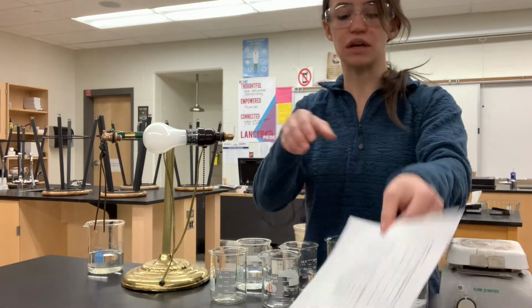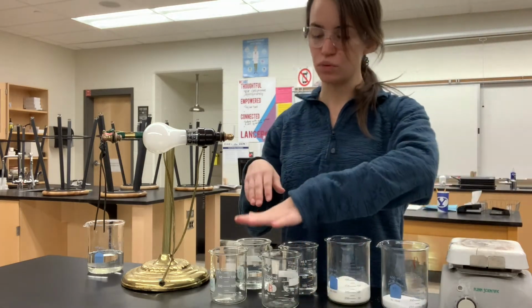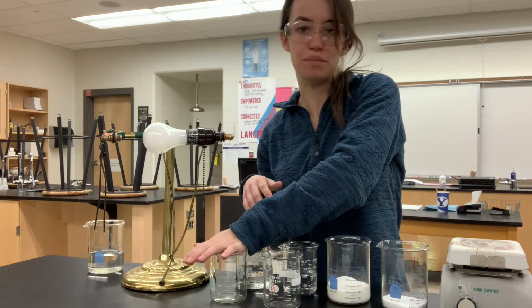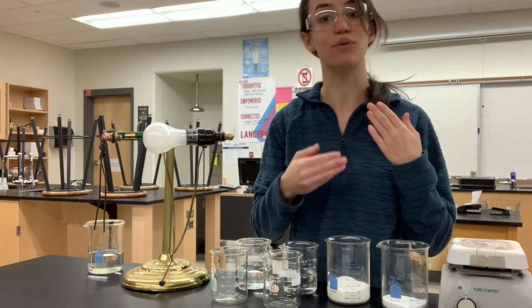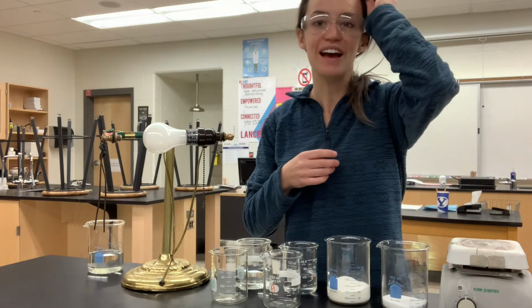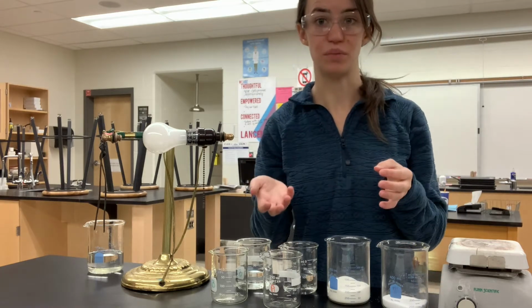The first one that we're gonna do is a melting point. How we're gonna do that is I'm going to put a spoonful in A and a spoonful in B, and then we're gonna set it on a hot plate and let it sit for 5 minutes and see if we can get one of them to melt. If you remember, ionic ones don't melt very well and the covalent ones melt pretty well.